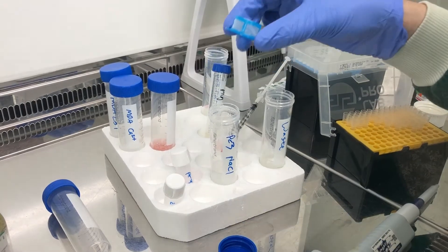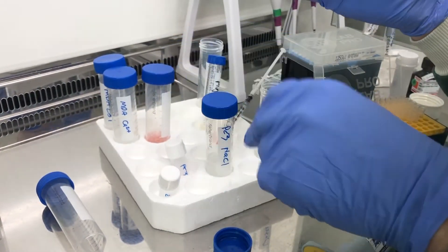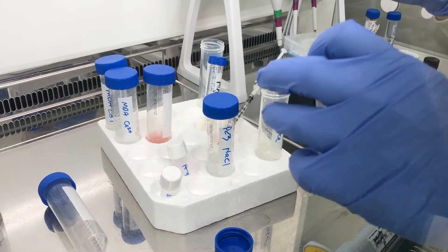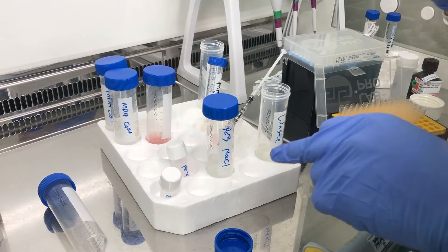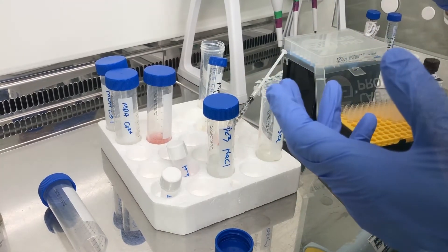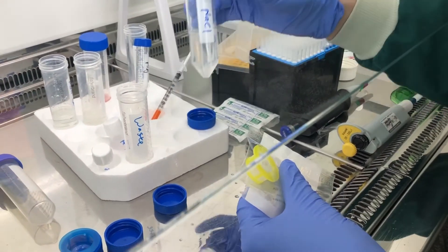Okay, so those are now in sodium chloride. It's not PBS. If you put them into PBS, then what will happen is there's still some phosphate in there and then when you combine it with the calcium you're trying to wash out, you'll get cloudy beads and you won't be able to see what's going on.